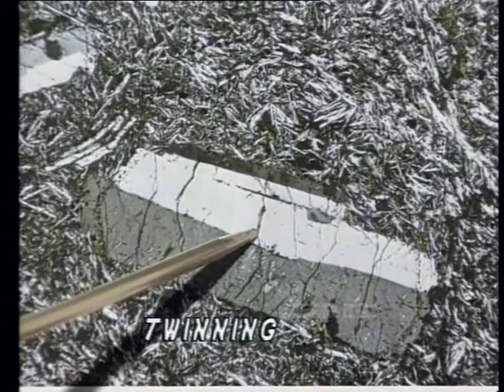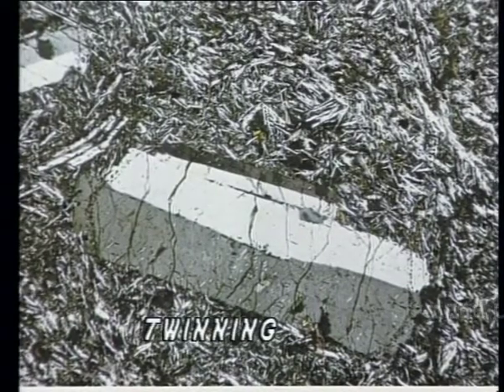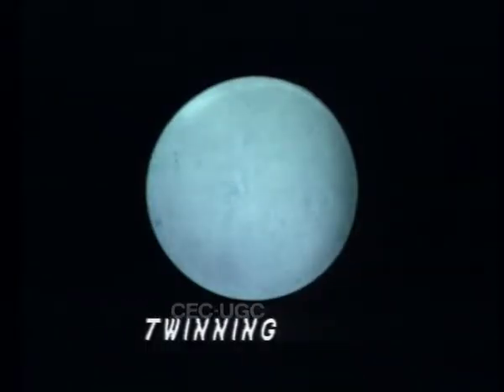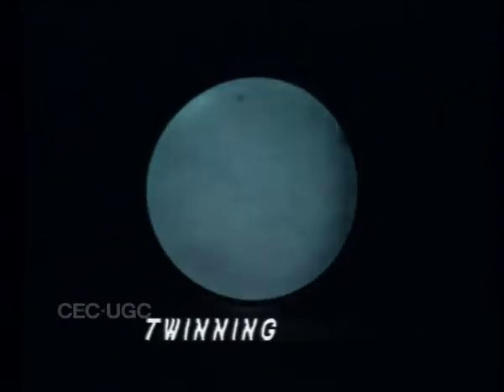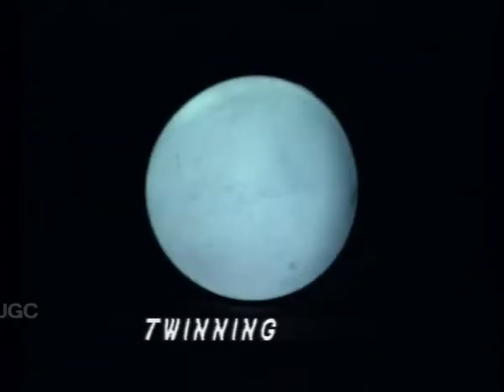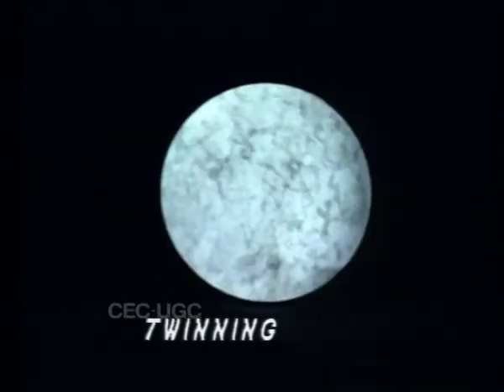Twinning is another feature that is observed in crossed position. In a normal crystal, the entire grain of a mineral will have a common crystallographic orientation and therefore arrive at extinction position at the same time. Twinning in minerals represents a deviation from normal crystal habit.